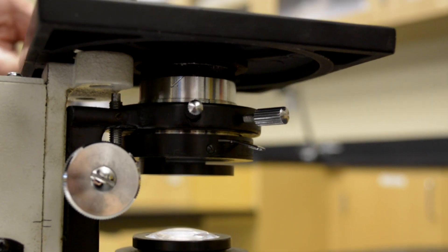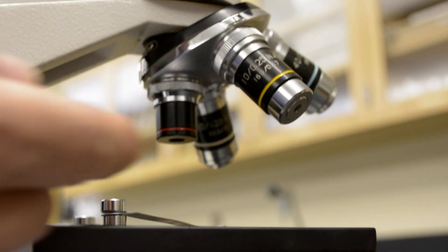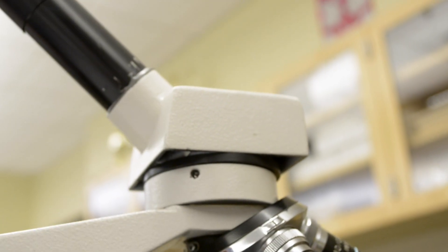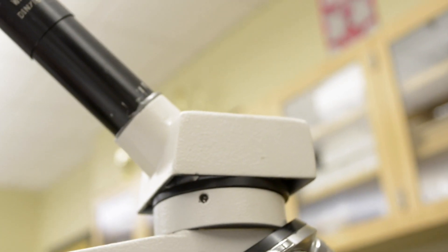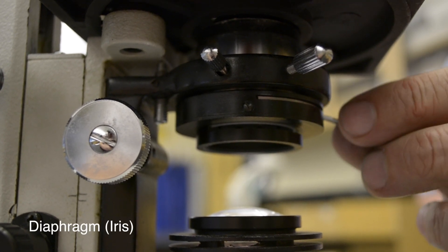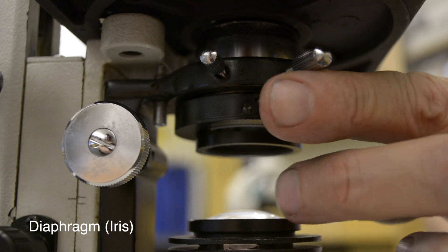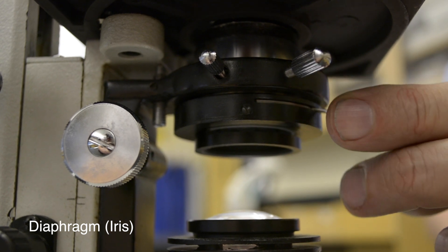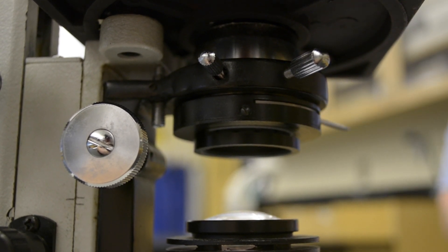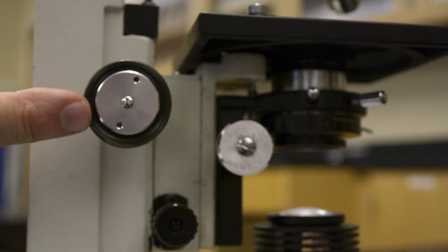The light from this passes through the slide and the stage, and the image that it carries is magnified as it moves through the objective and ocular. The intensity or strength of the light can be adjusted by the diaphragm, which is found directly below the stage. By adjusting the diaphragm, you can control how much light actually goes through the slide.